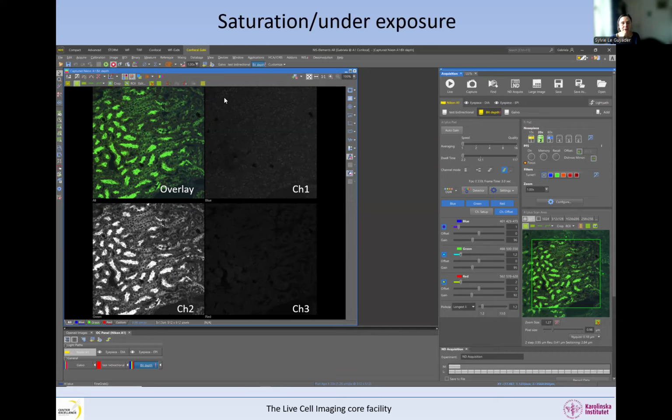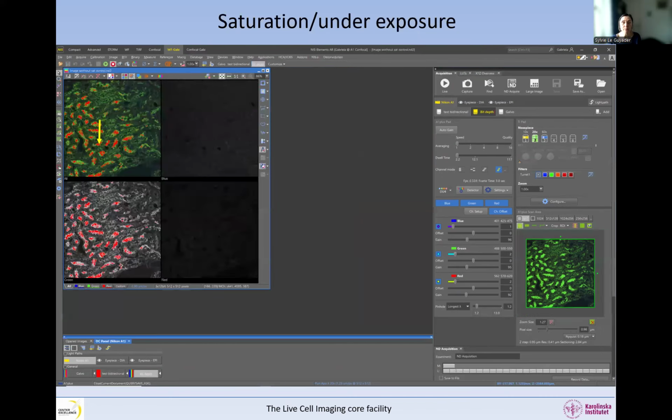In this image we have 3 channels, 1, 2, and 3, and this is the overlay. At first glance, it may look like channel 1 and channel 3 are very dim, and they are not acquired correctly, whereas channel 2 is okay. However, that's not the case. So if we push the saturation mask, what we can see is that channel 2, this channel, is actually saturated, and the others are not.